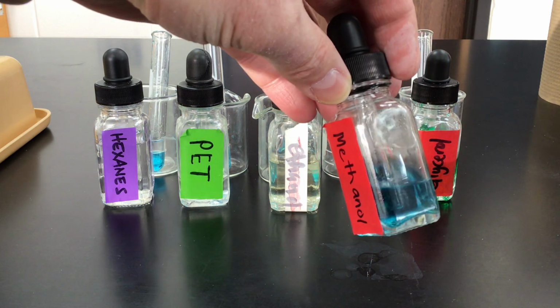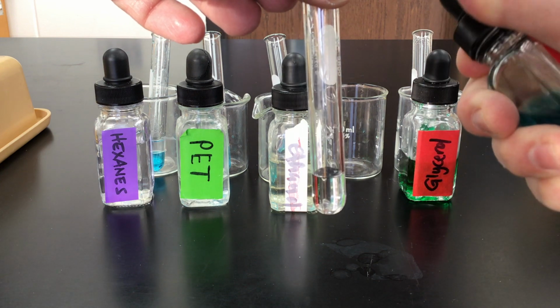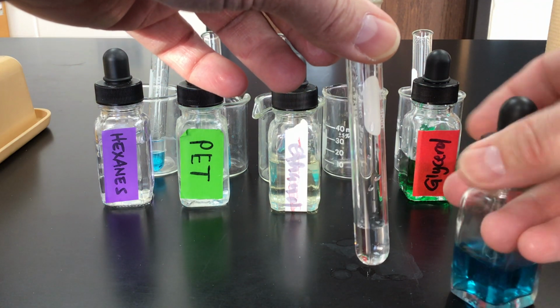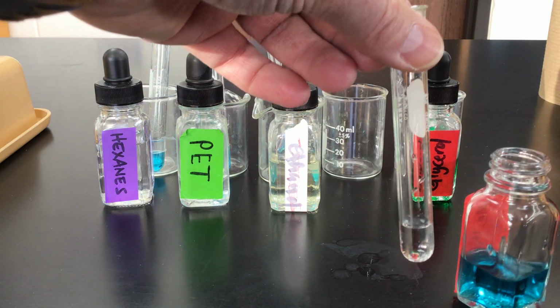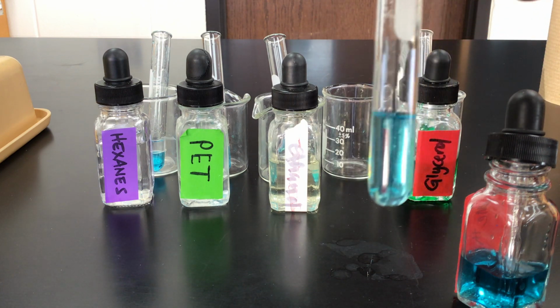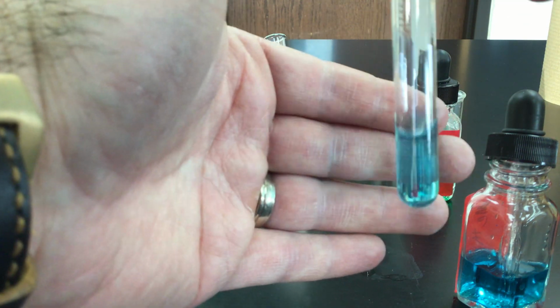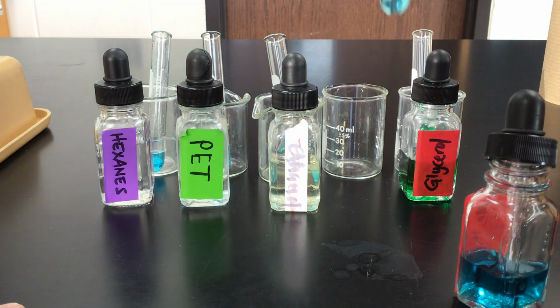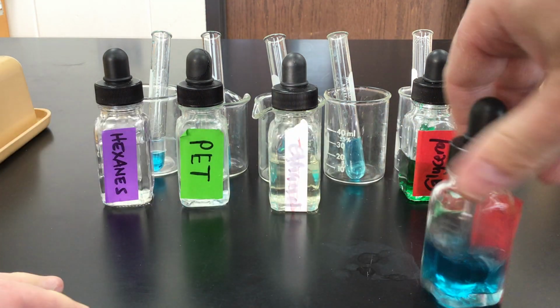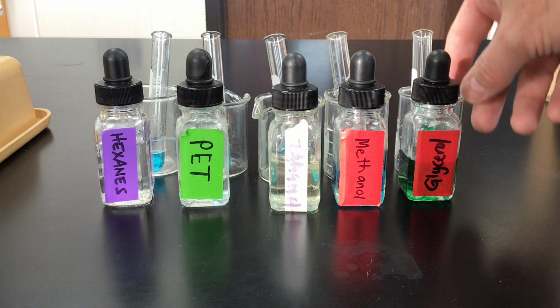All right. Next, we're going to do methanol, which we colored this greenish blue color. And then I left the water colorless. All right, so let's go ahead and mix these. All right, give it a shake. And we can see that it is soluble in water. In the production of booze and like stills, one of the first things that's made is actually methanol. If you ever watched the show Moonshiners, the methanol is produced at first, and they have to get rid of that because it's really bad for you, can make you go blind or worse. All right, but anyway, methanol is soluble in water.